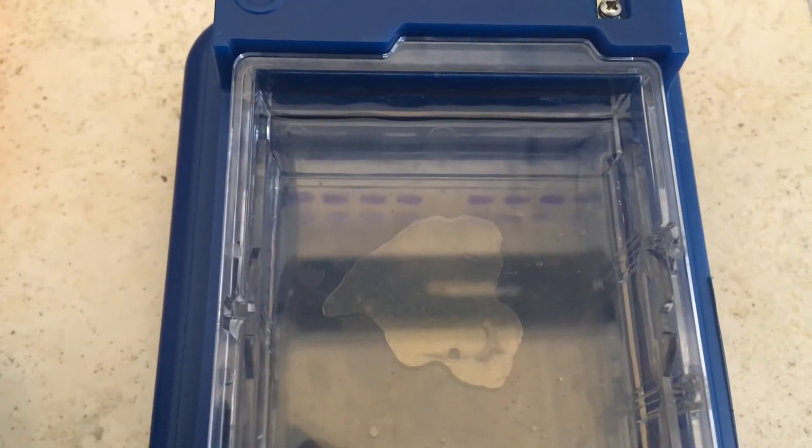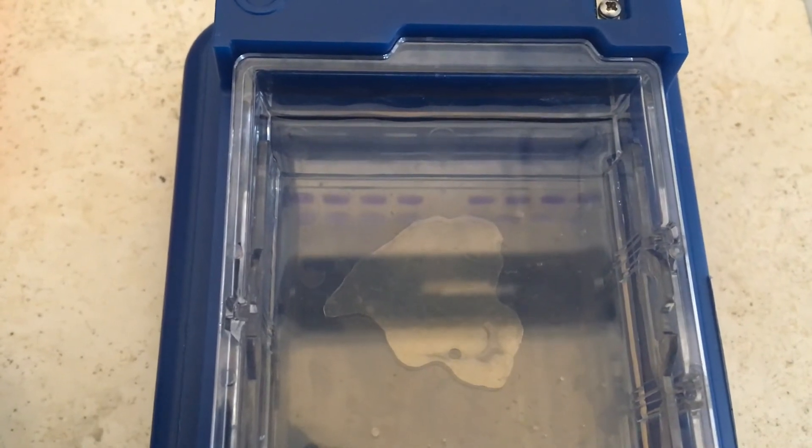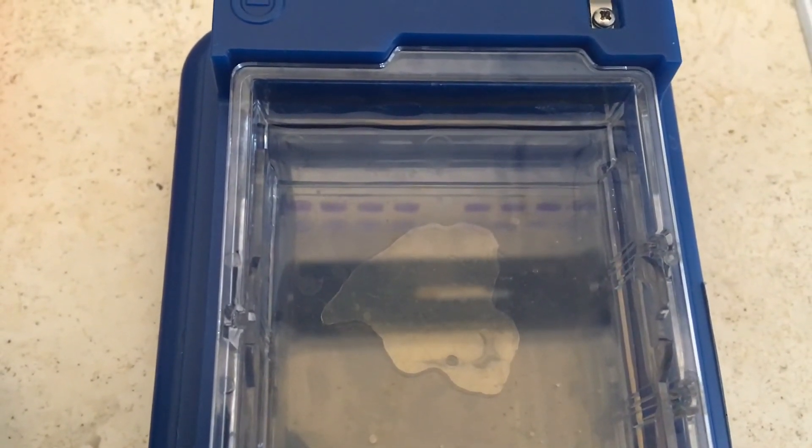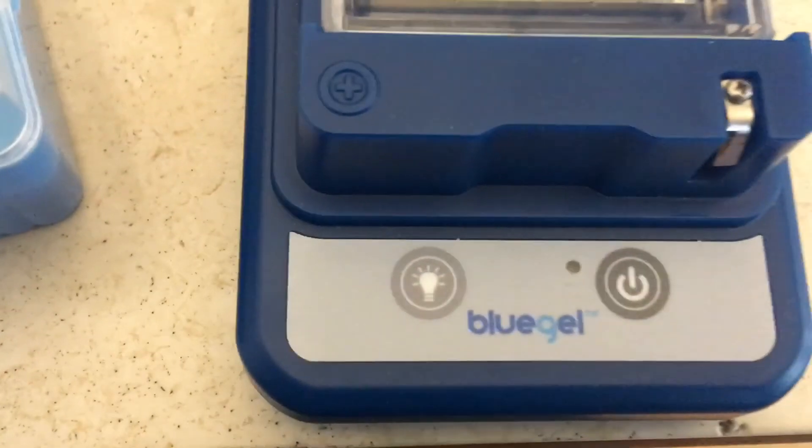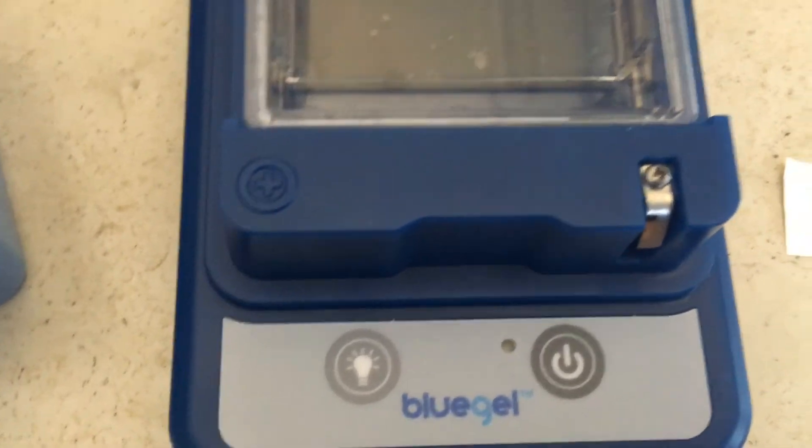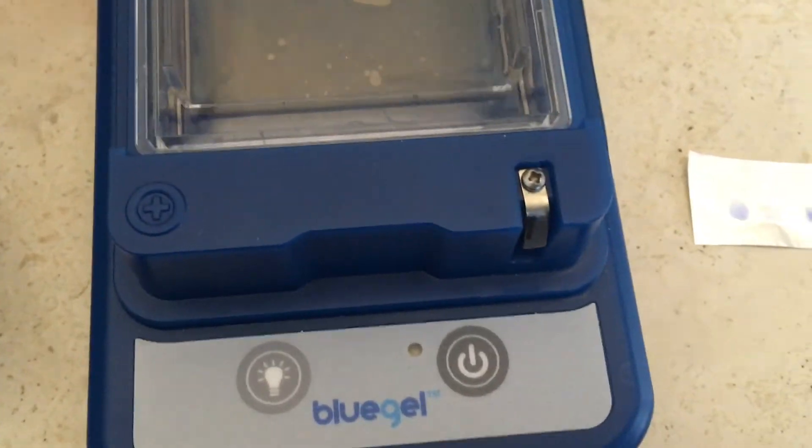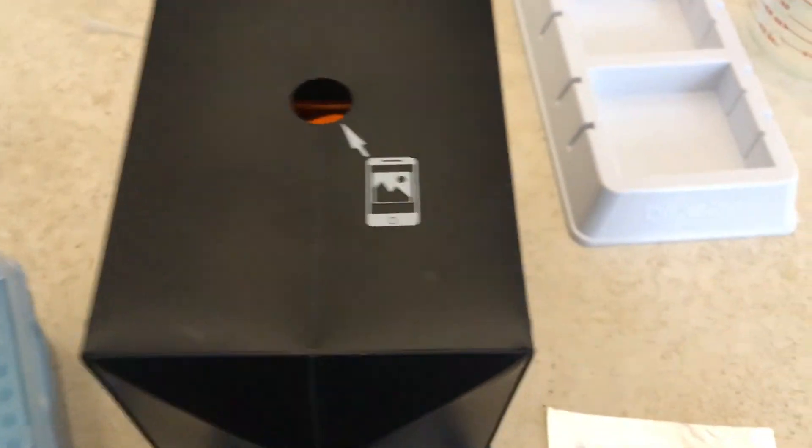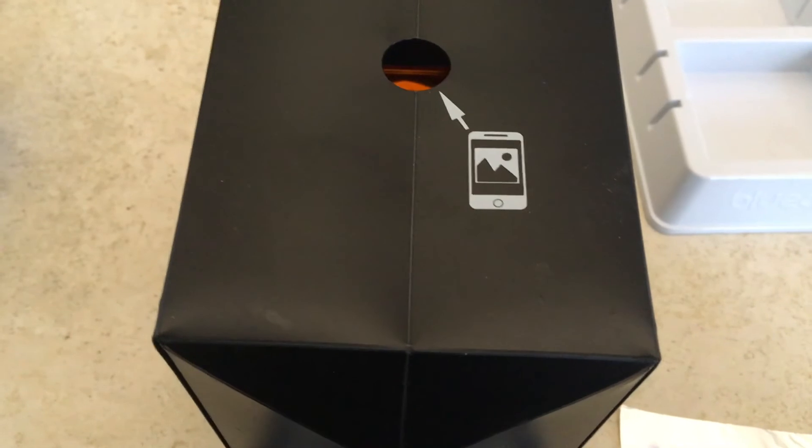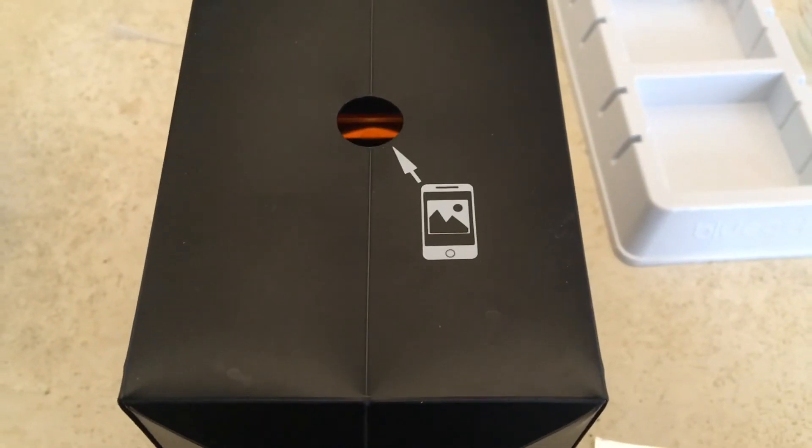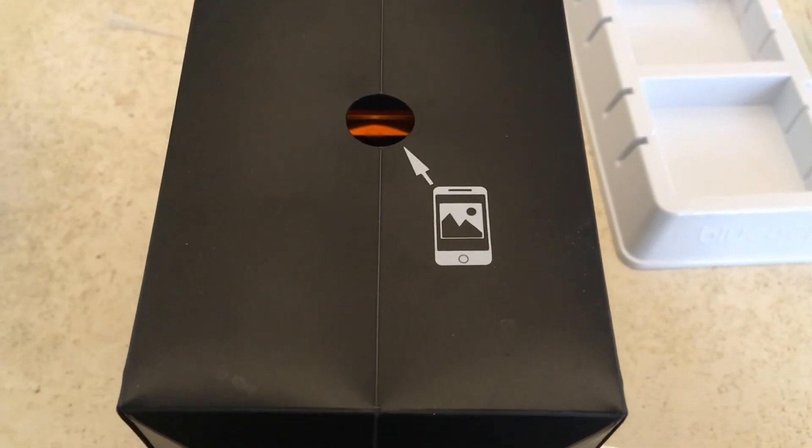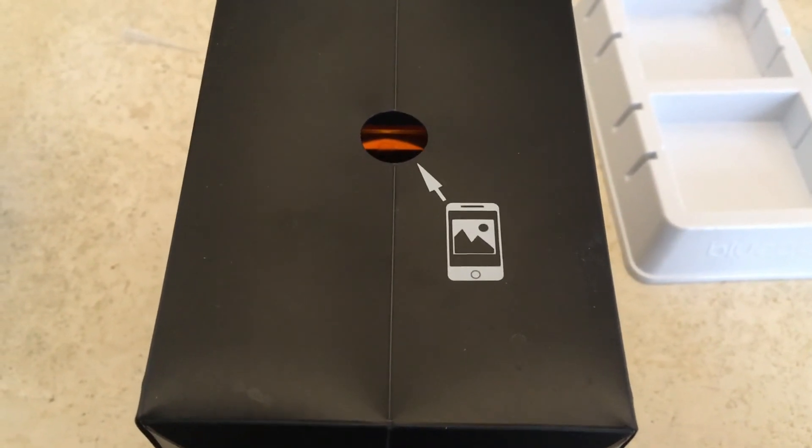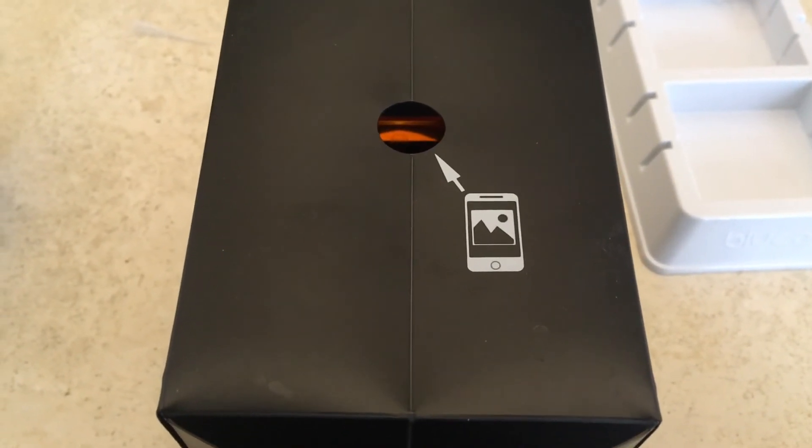So that's all of our DNA loaded and the next step will be to look at it with the trans-illuminator once we switch on the current. So we're going to switch this on and then we're going to put the black cover over it. And then in a couple of minutes we're going to be able to see if there are bands. Obviously when there's a band that's good, that means it worked. If there's no band it means the reaction didn't work.